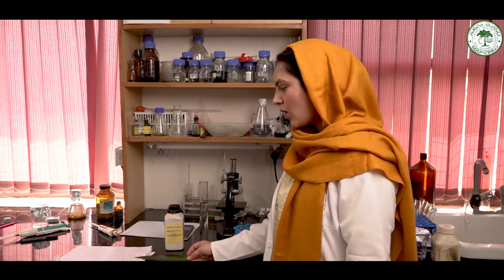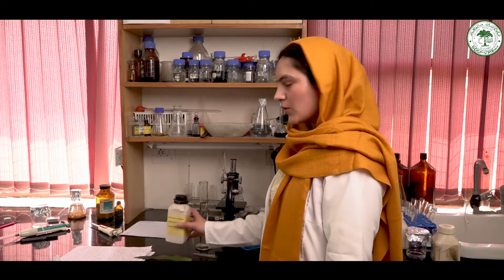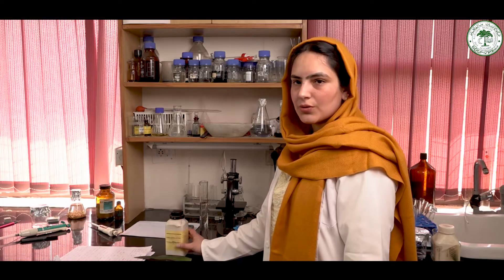In this experiment, we require Tradescantia leaves. As you can see, its upper surface can be easily distinguished from the lower surface. The upper surface is greener in color, while the lower surface is purple in color. We also require sodium chloride to prepare the hypertonic solution and distilled water.